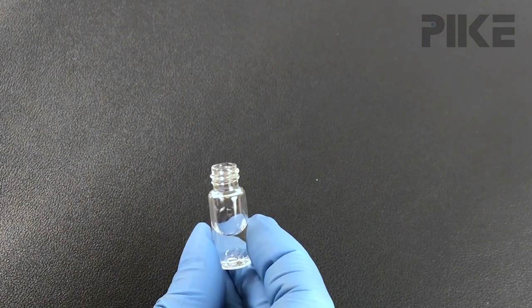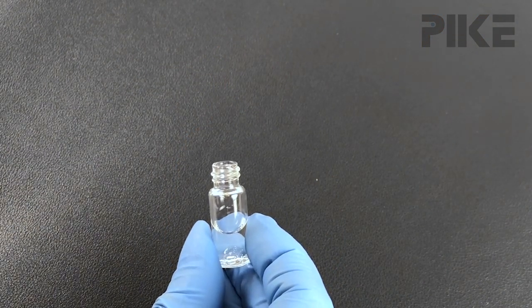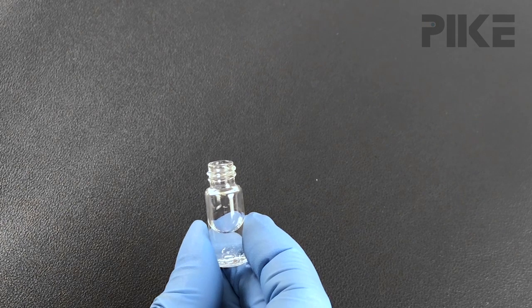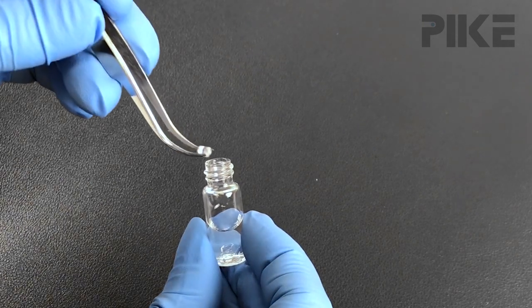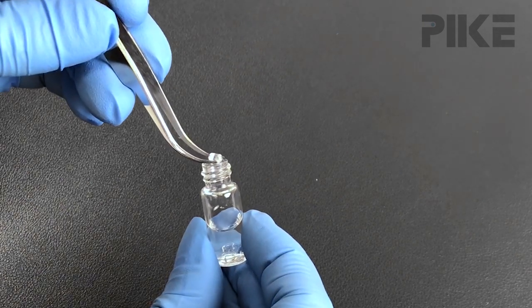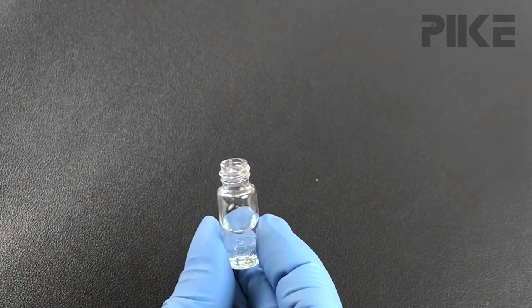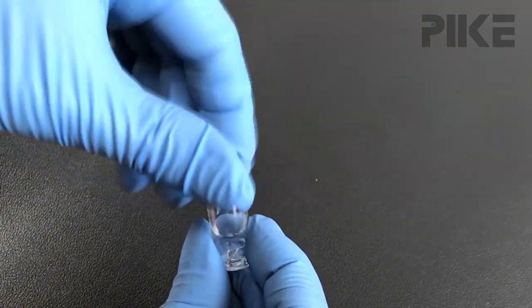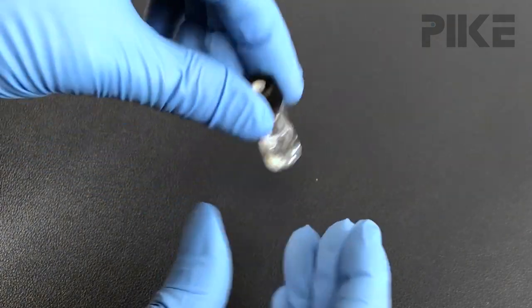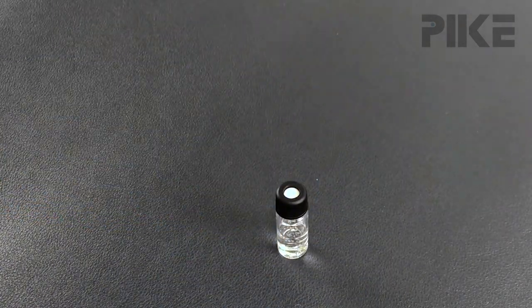First, take a vial of compatible solvent. My sample was plexiglass — just place a piece of your sample into the vial. Step two, cap it off and let the solvent dissolve your sample.